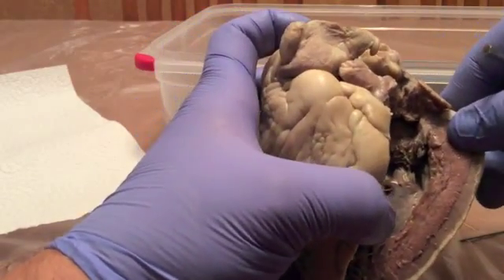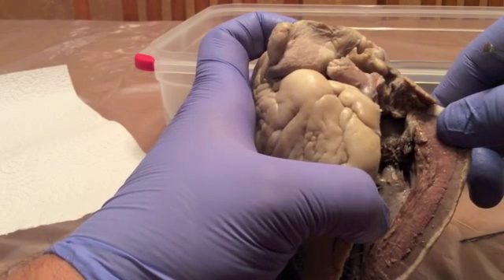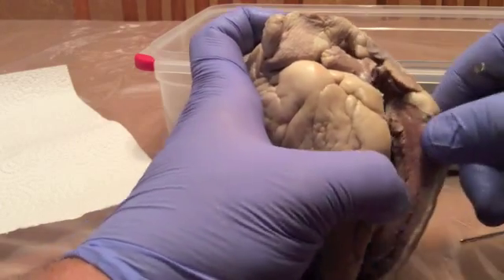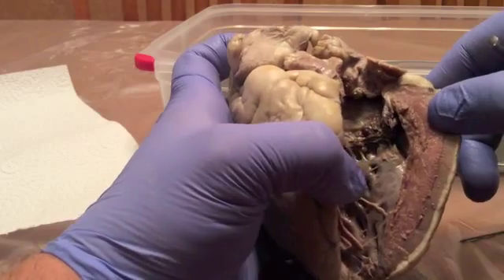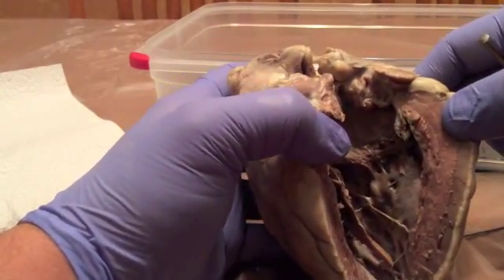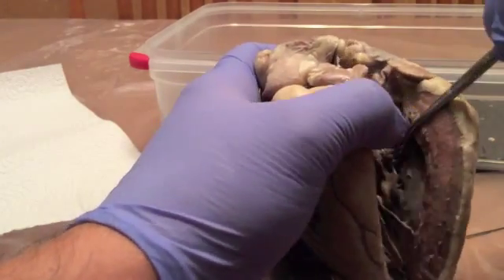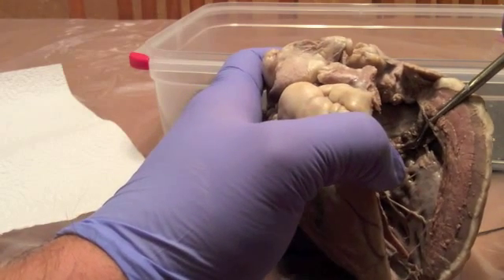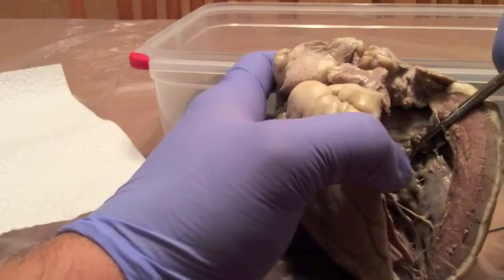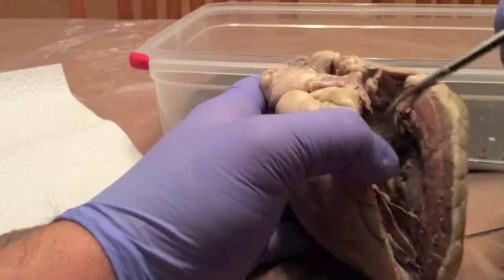Look at the left ventricle now. You can see that the myocardium is definitely thicker due to the purpose of the left ventricle to pump the blood to the remainder of the body, unlike the right ventricle that gives it to the lungs. You can see a lot more structure in here than the right ventricle, just due to the size we're able to open it up. We got a bicuspid valve, which is a lot stronger than the tricuspid, because you only have two different parts rather than three. Got the tendinae that helps keep it closed. We got the septum here that you can see.